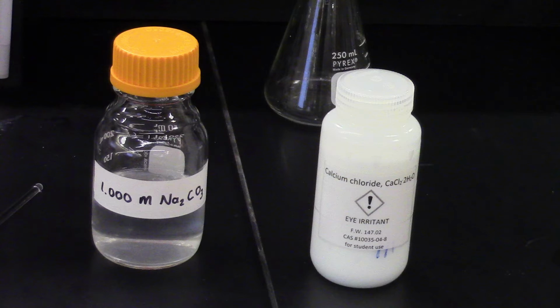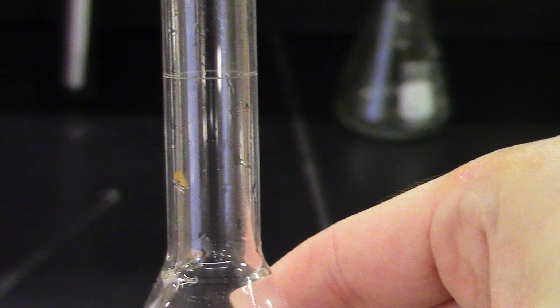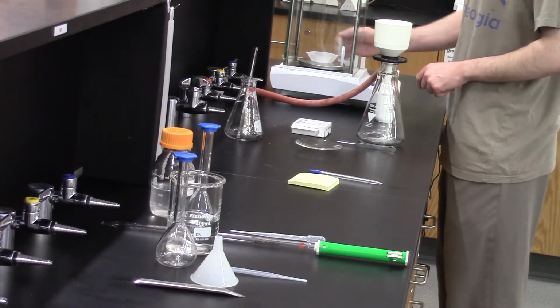Starting from our reactants, we're going to prepare 2 aqueous solutions. Since we'll need to know the molarity, we're going to prepare these in 100 milliliter volumetric flasks. A volumetric flask is used to very precisely measure exactly 1 volume, in our case 100 milliliters. If we zoom in, you can see a mark on the neck of the flask. When the liquid level sits exactly on this line, we'll know that we have 100.00 milliliters of solution in the flask. Let's prepare our solutions, starting with the calcium chloride.